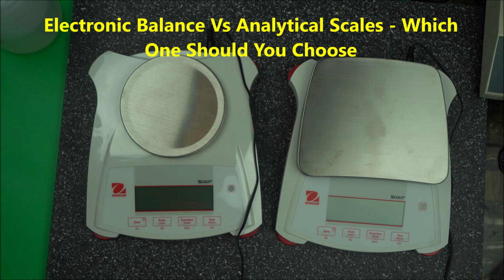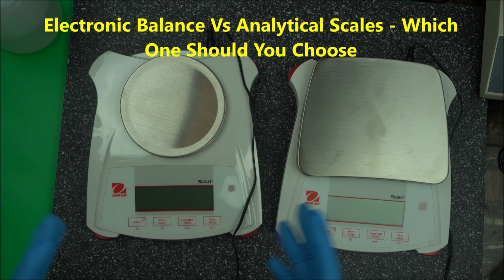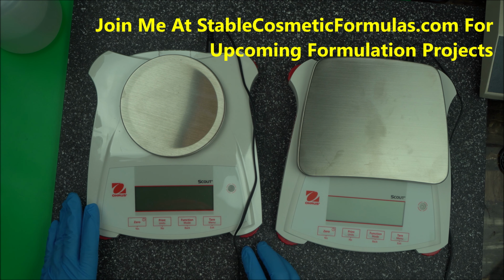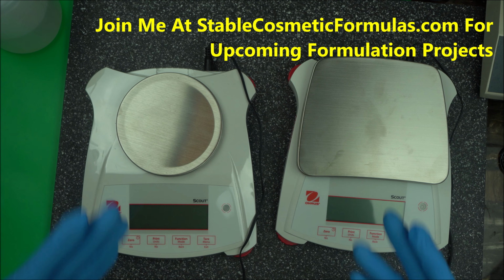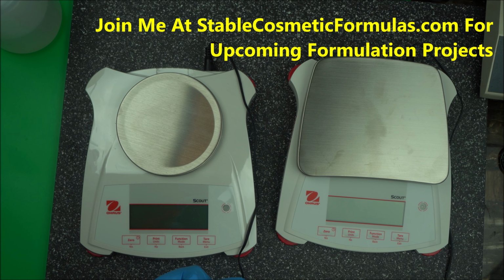In this video I'm going to tell you the difference between analytical scale and electronic scales. When we're talking about scales in the lab, this is going to be about cosmetic formulation in the lab. When we talk about scale, we talk about the tool we use to measure our ingredients, right? So we use it to measure ingredients for cosmetic formulation.